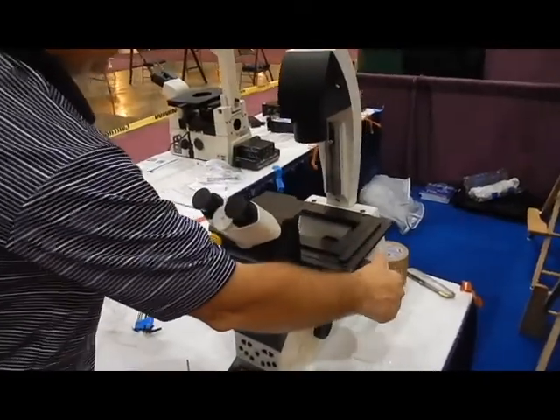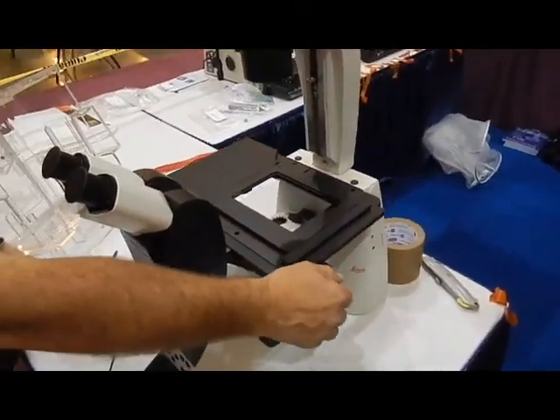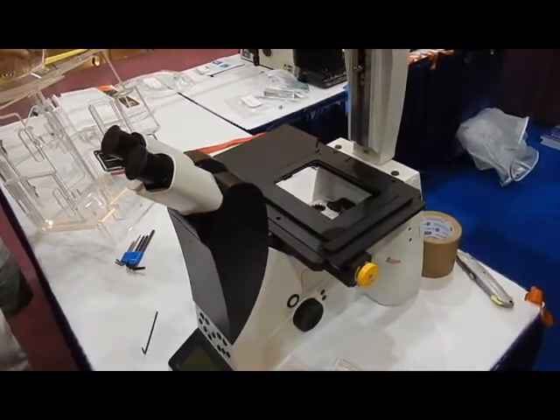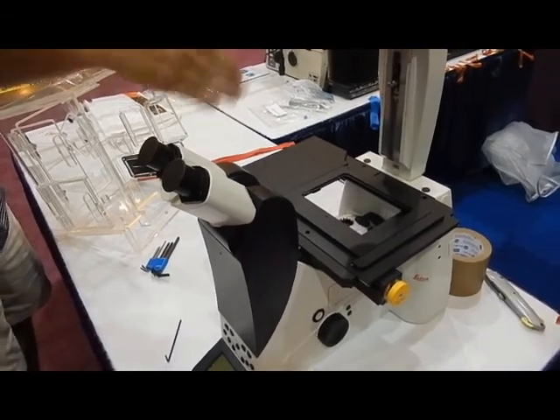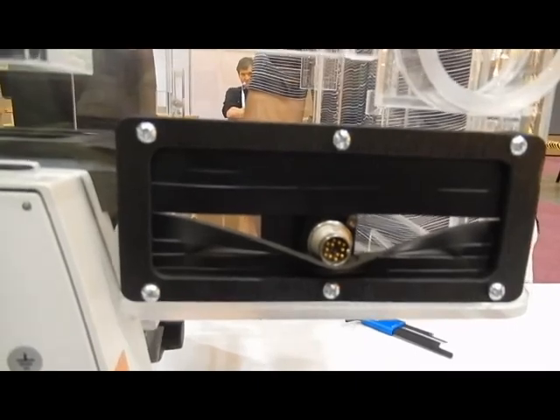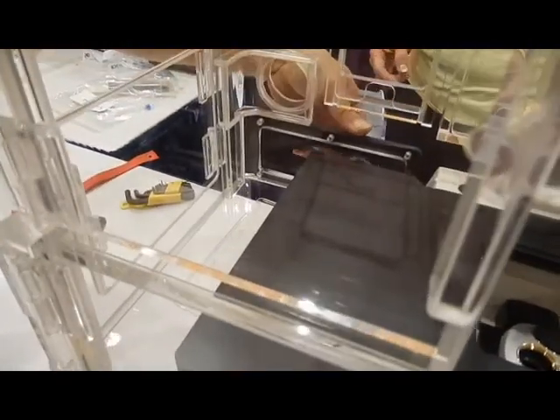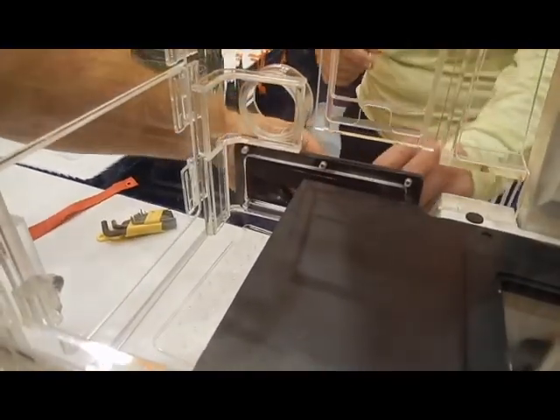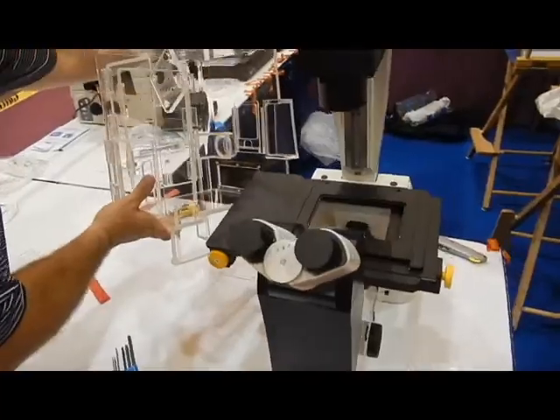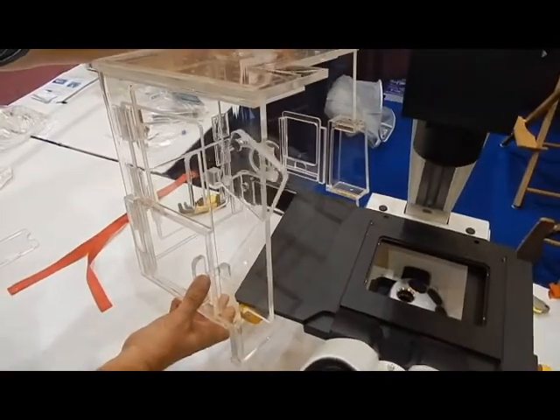Then adjust the stage as needed so that the left side of the chamber can be mounted. It should be centered. Position the left side of the chamber so that the microscope stage electrical connector can be fed through the black slotted port on the back side of the cage. Then gently maneuver the left side of the cage until it slides into place.